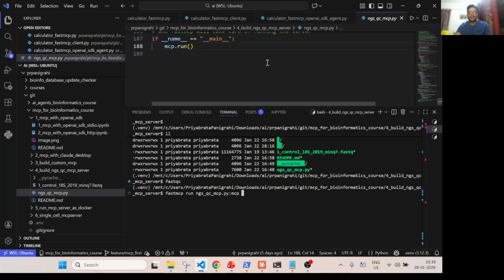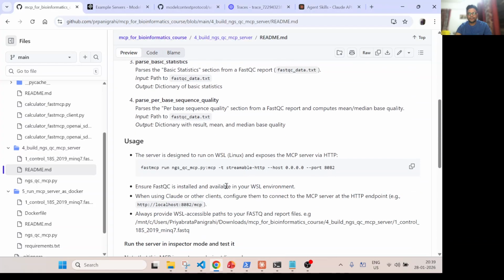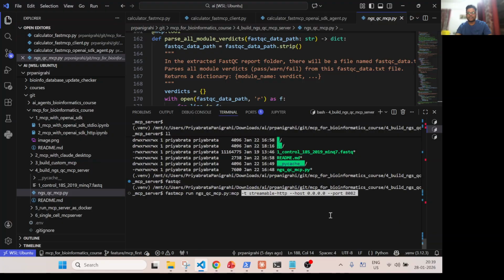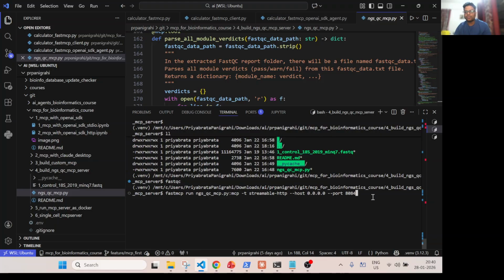And then I am telling what mode of transport I will be running. So I will say streamable HTTP, host 0.0.0.0, port 8082. Okay, so let's run this. Let's go with 8084, because I think some ports might be running, you can check which port. So 8083 is running, so let's go with 8084.